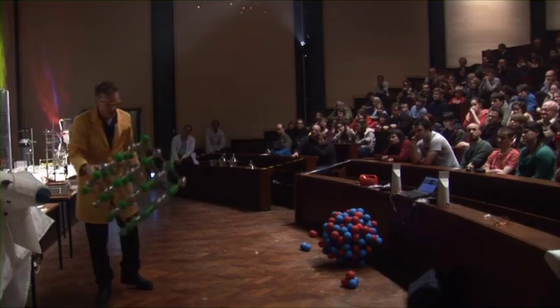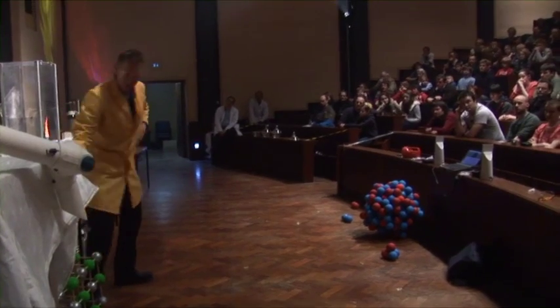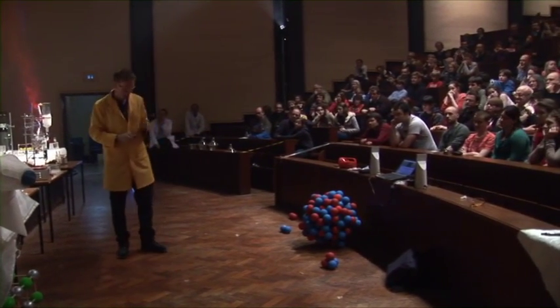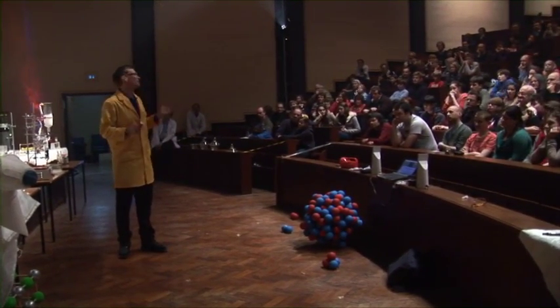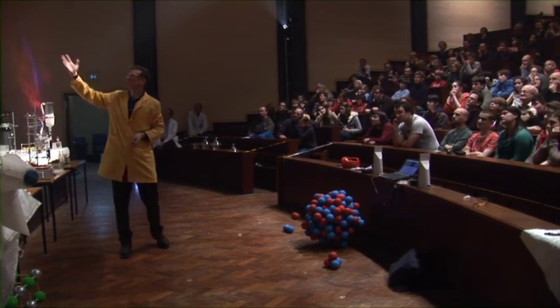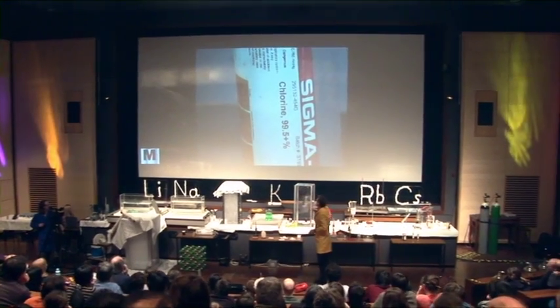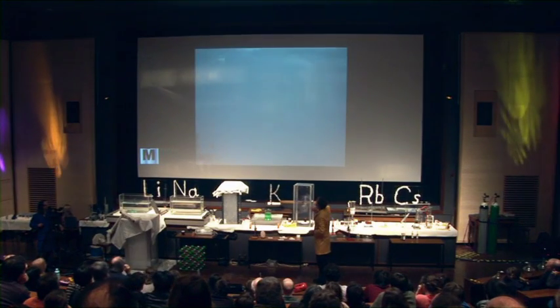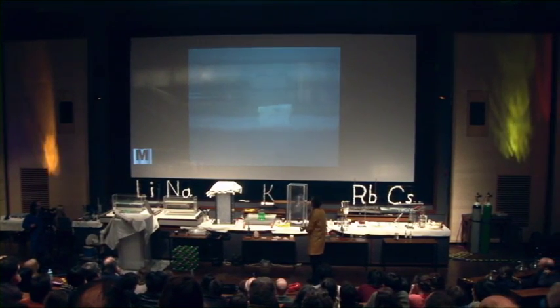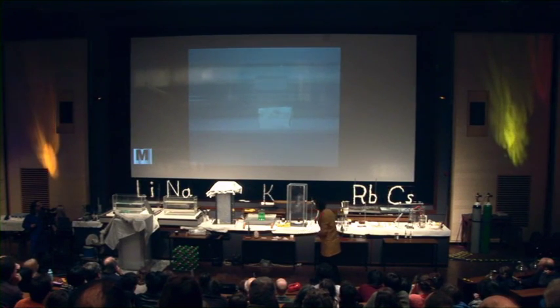Unfortunately, I couldn't show you the process where sodium and chlorine combine because the chlorine is so poisonous. We did a quick video — maybe we can show you this. Here's the chlorine cylinder. We're about to pass the chlorine — this is a green gas — over some sodium. Here's the sodium. We recorded this the other day in the fume cupboard.